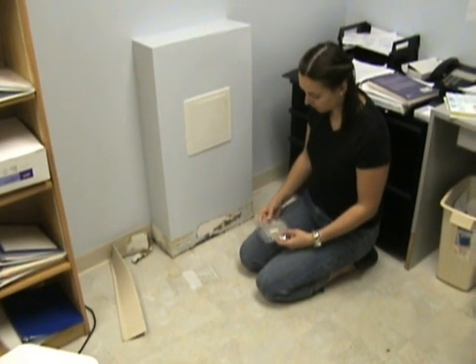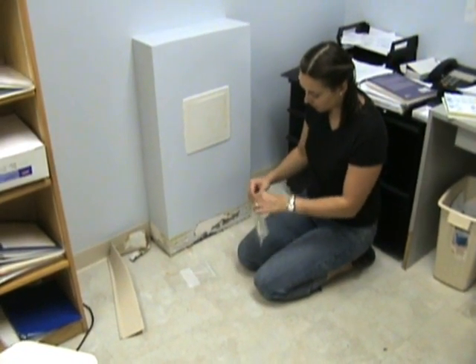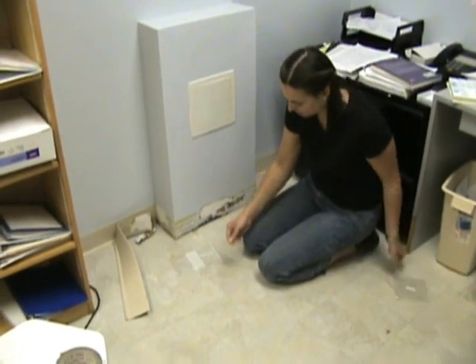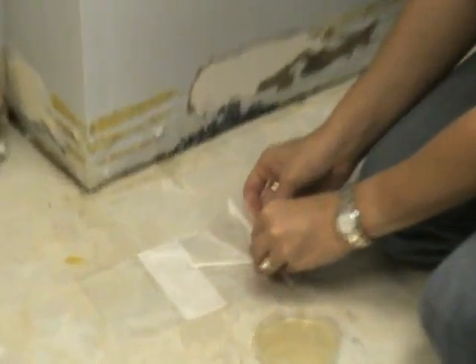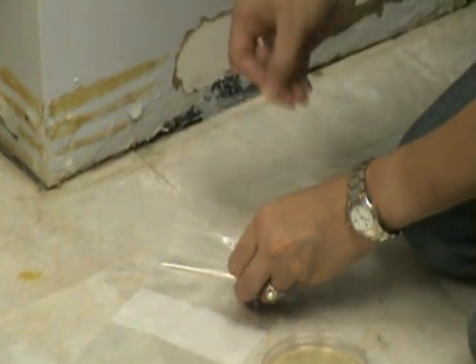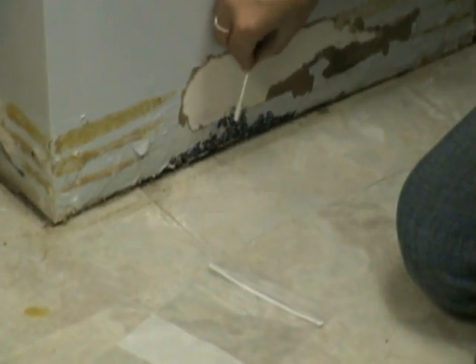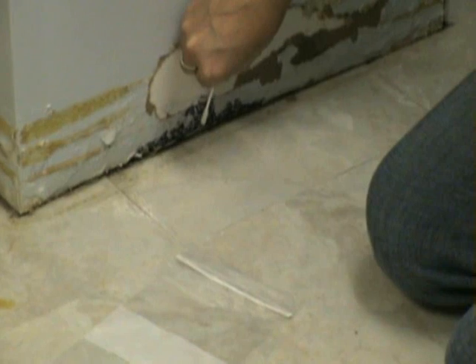To conduct the viable topical test, remove the test kit from its packaging. Then remove the cotton swab from the pouch, being careful not to touch the end of the swab. Take the swab in your hand and wipe the surface gently to capture the suspected mold onto the swab.